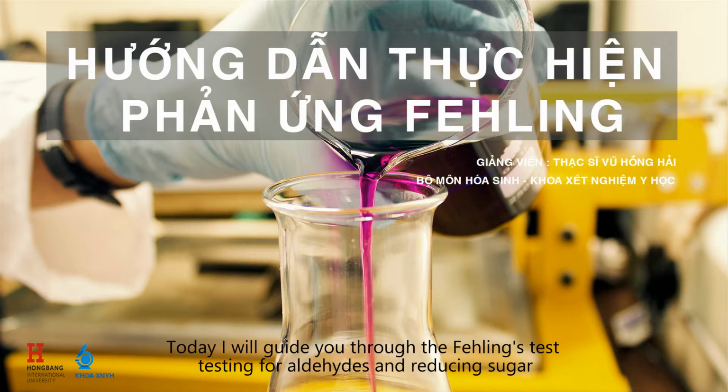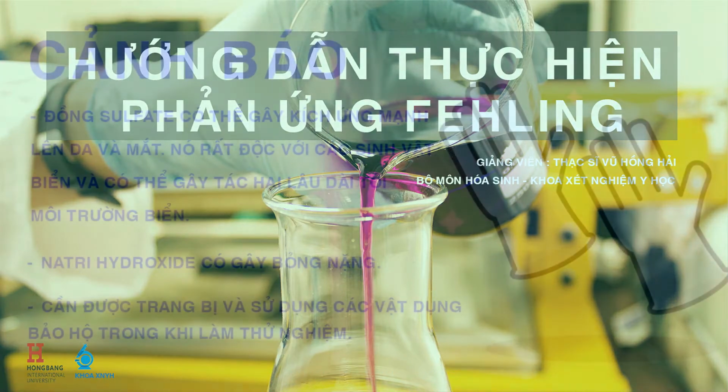Today I will guide you through the Fehling's test, testing for aldehydes and reducing sugar.